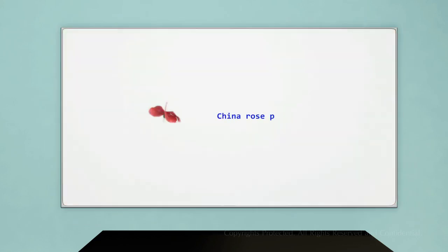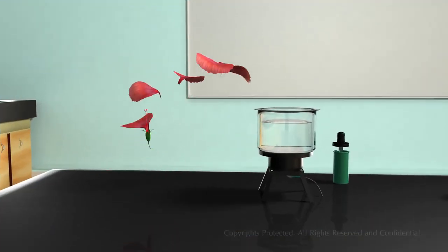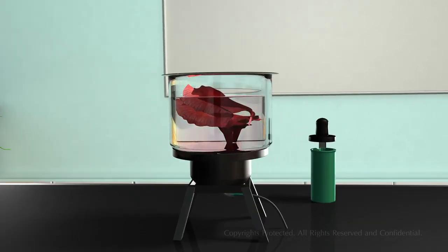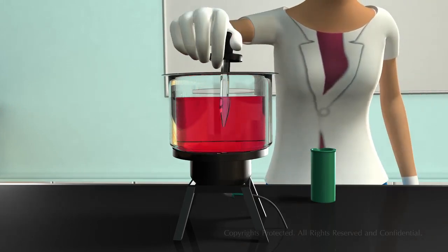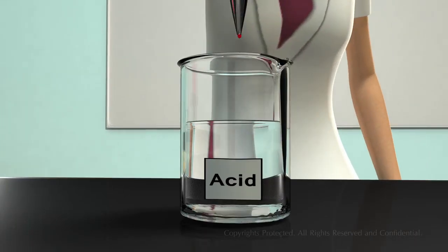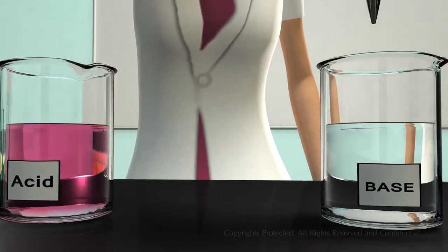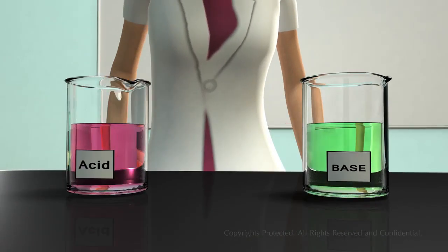Another commonly used natural indicator is the China rose petals. Prepare a China rose solution by putting its petals into warm water. Take a few drops of China rose solution and pour it into a beaker containing acid. You can see that the acid changes to light pink in color. Repeat the same process for the base solution. The color of the base solution changes to green.